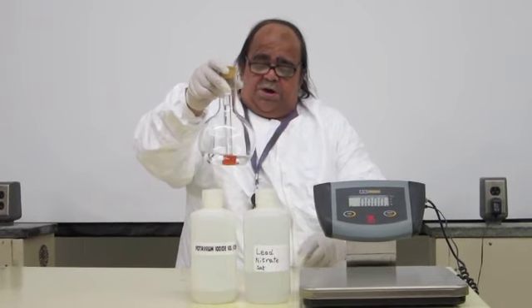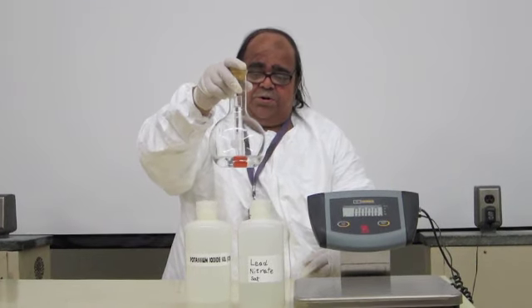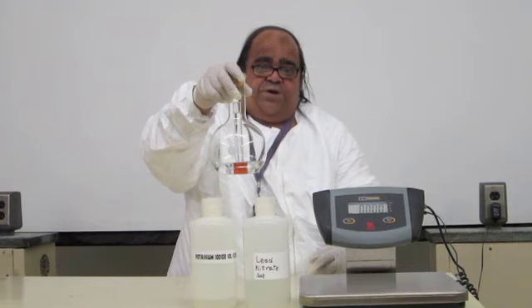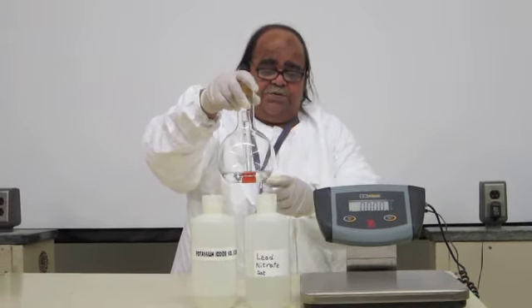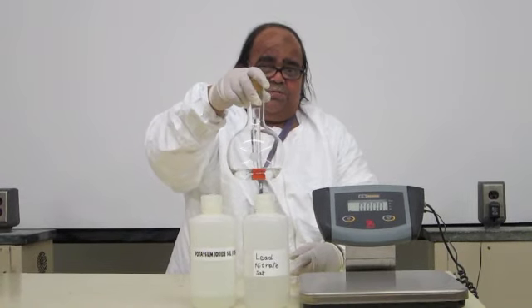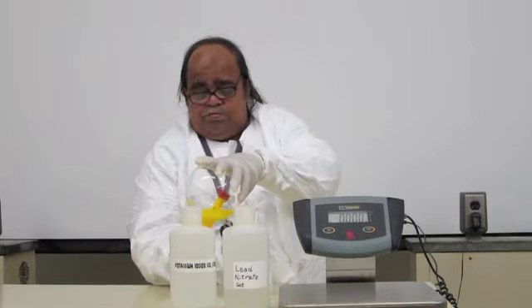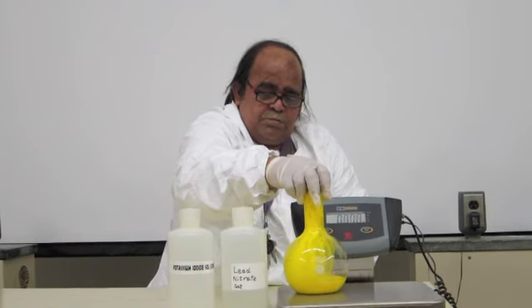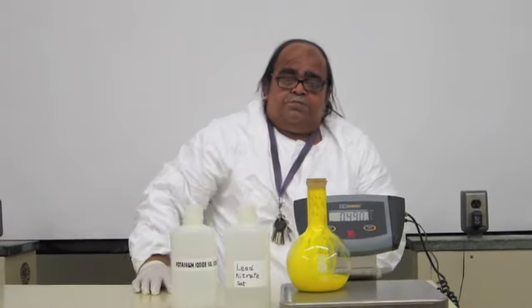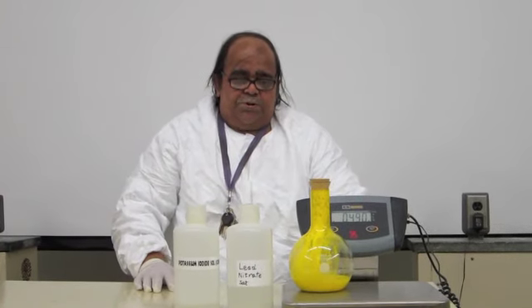Now when I turn this glass upside down, the two chemicals are going to mix and react. You'll notice the weight of the two of them on the scale before, and you shall see what happens when they react. You'll be responsible for the questions posed to you.